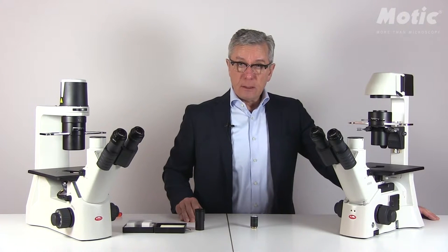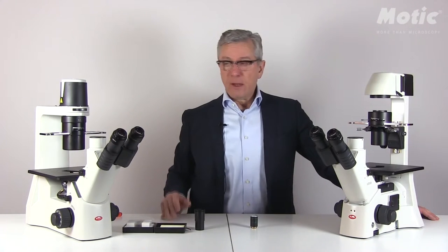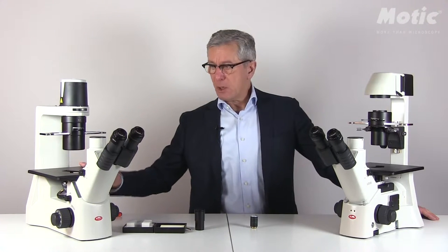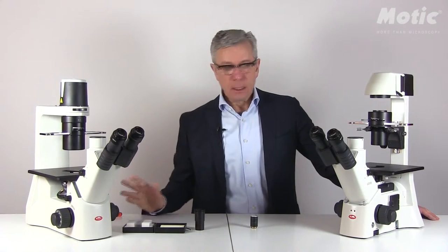Before we start with the phase contrast, make sure that your complete alignment of the microscope is done properly for bright field use. For the AE2000 this makes no problem at all because we have no Köhler option here. So just place your sample on top of the stage and focus.